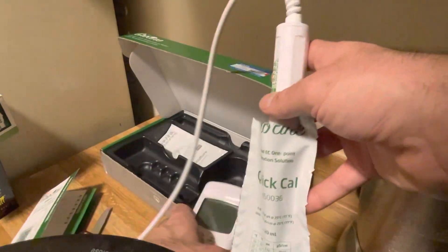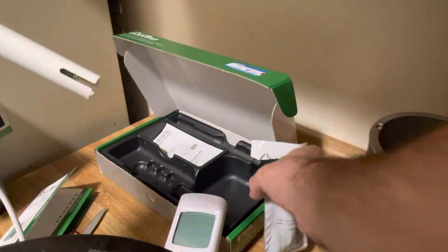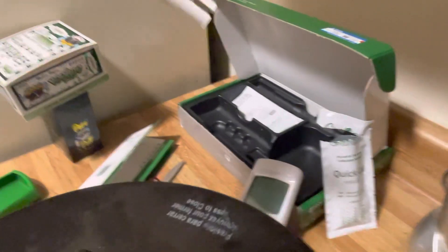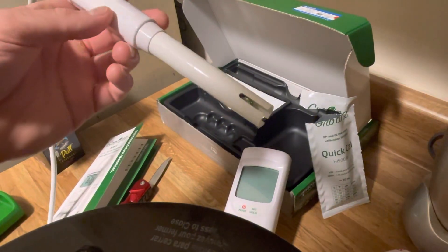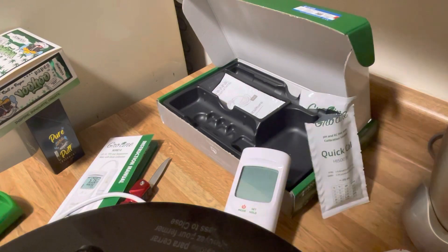This is now calibrated for sure and it's ready to use. To exit the calibration you just hit any button like they said. You can rinse your probe off, then take your probe, rinse it off, put it back in the storage with the lid, and put it to good use.